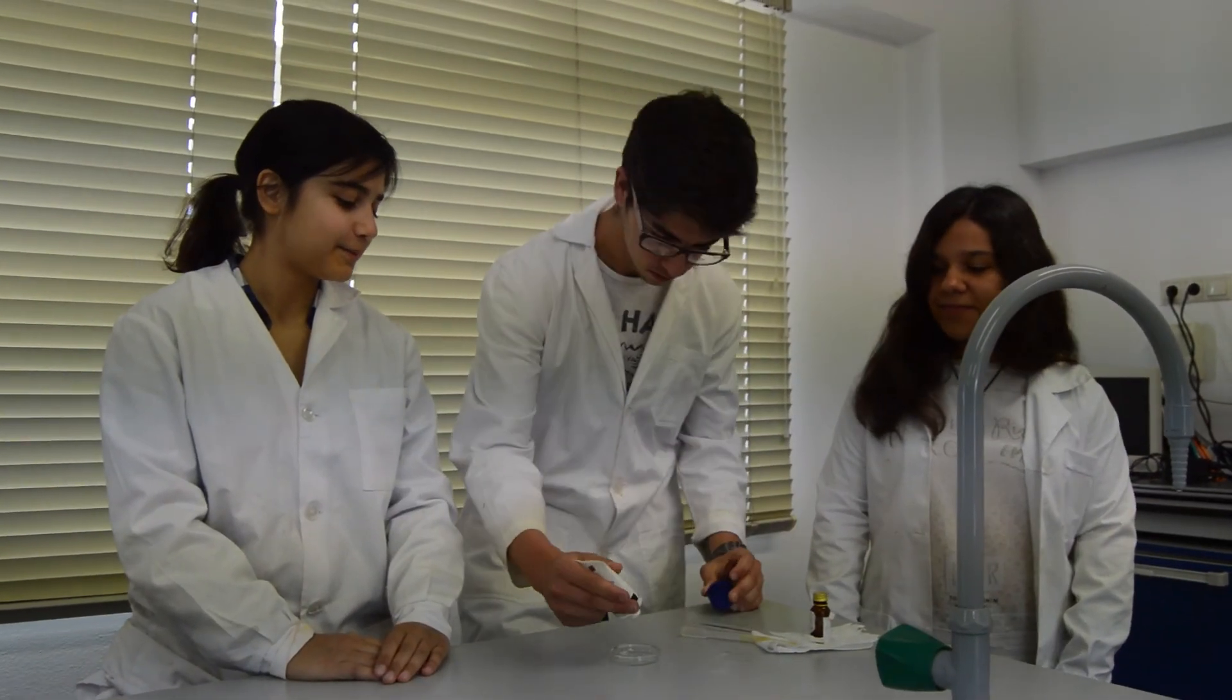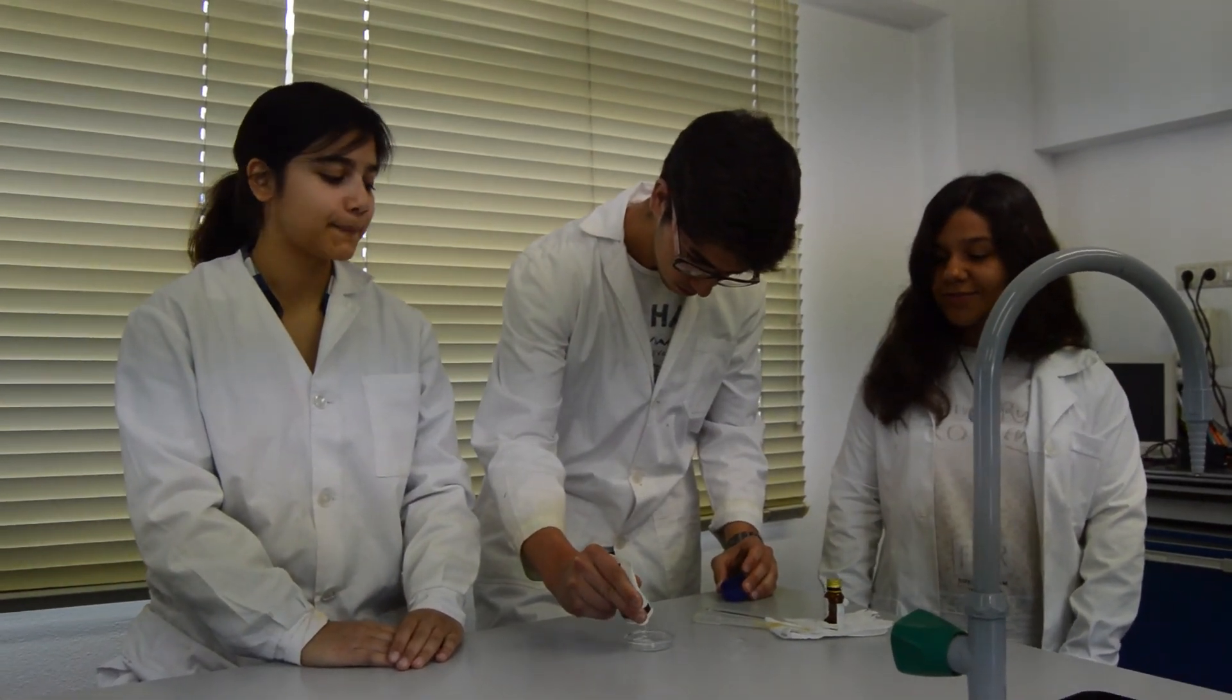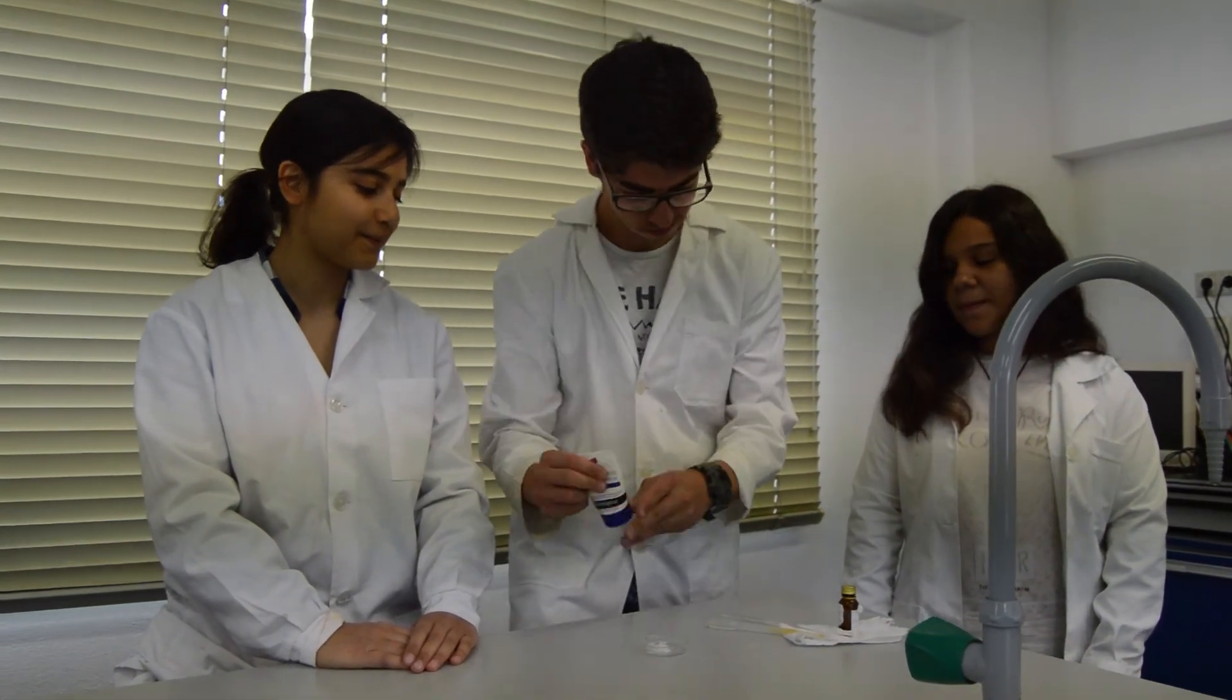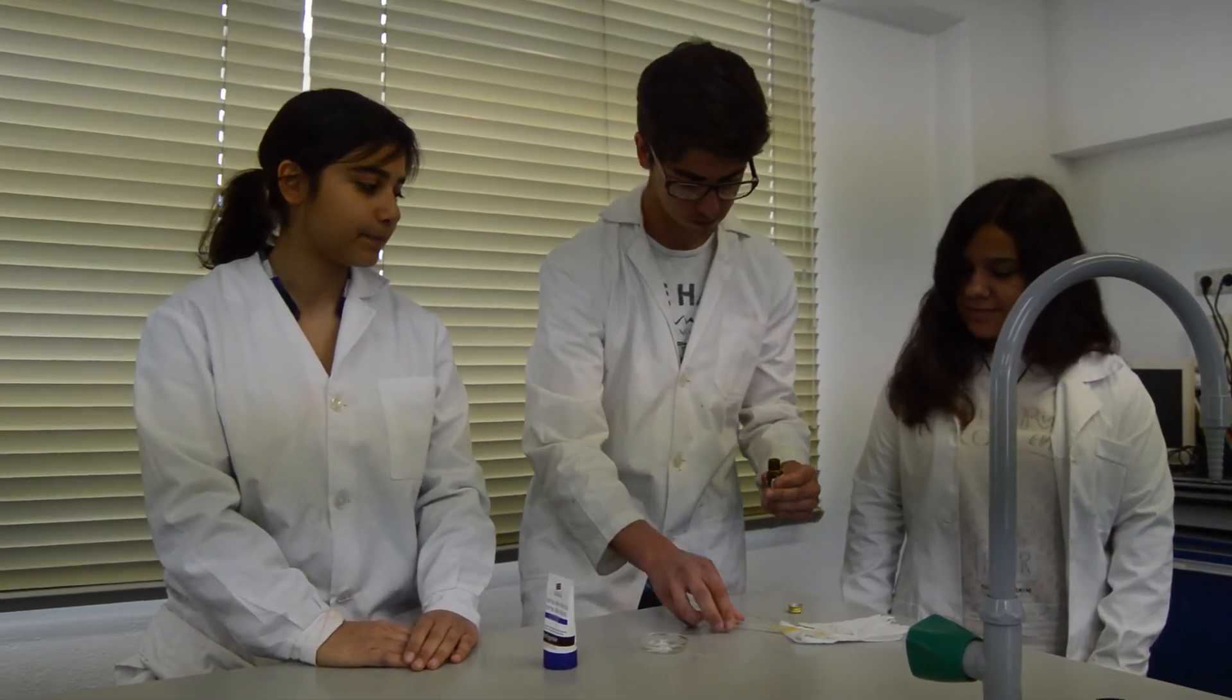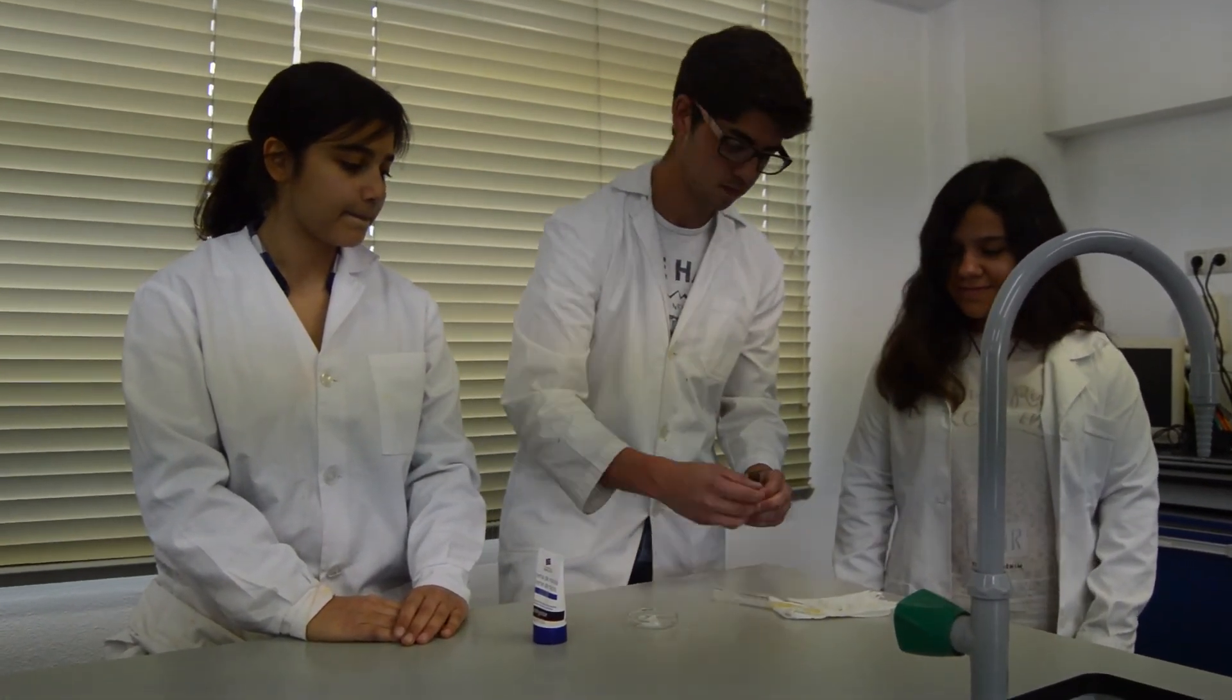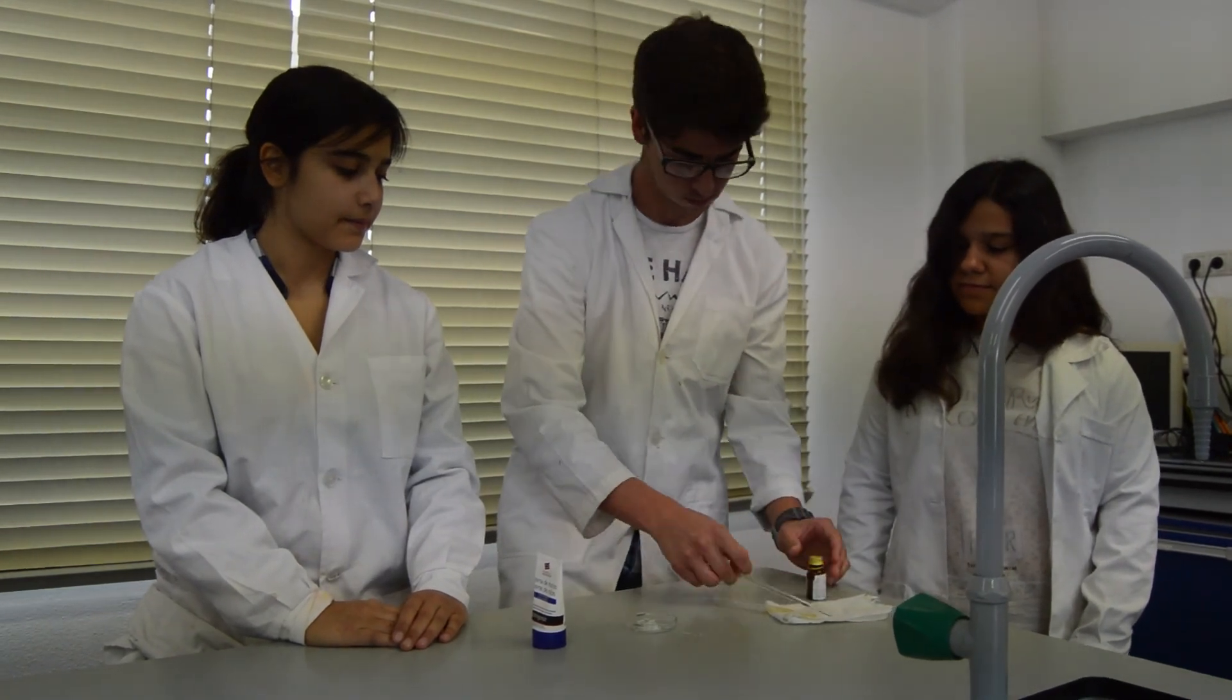We are now going to apply the ester that we have produced on our moisturizing cream. However, we are not going to test our product since we haven't purified our ester and, because of this, it might have toxic products in its composition that could cause skin irritation.